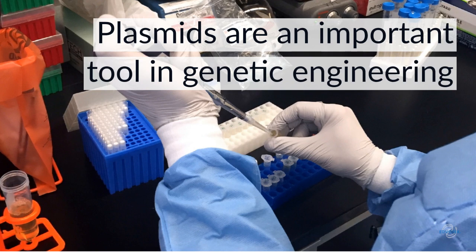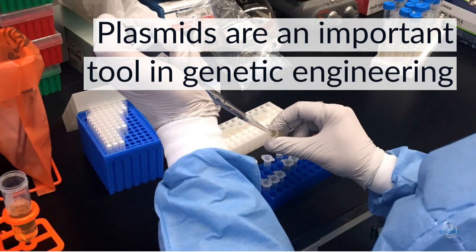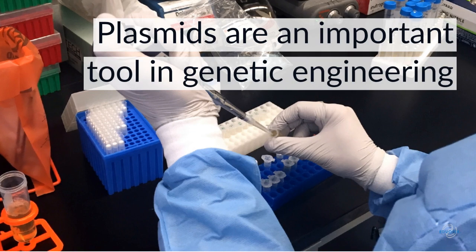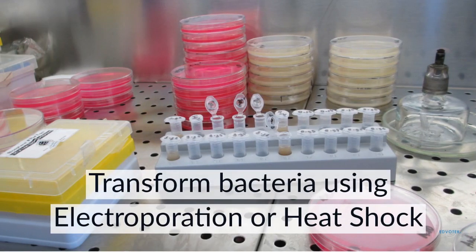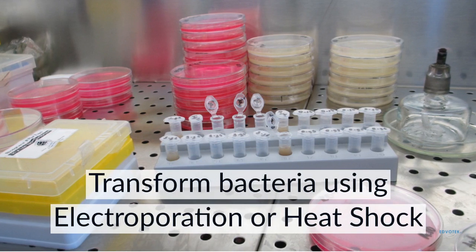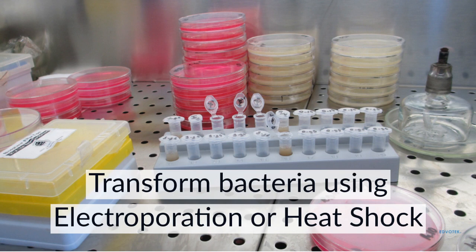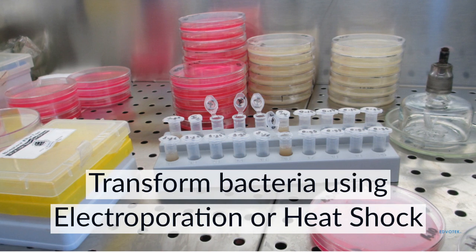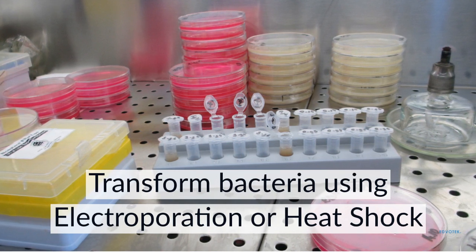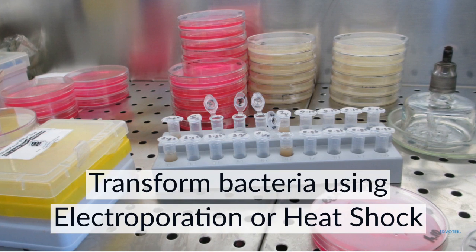In the classroom, we can program E. coli with a jellyfish gene, making them glow bright green. Since E. coli are not naturally competent, we need to force them to take up plasmid DNA in the lab. This can be done with electricity, in a process called electroporation, or through physical means, in a heat shock.